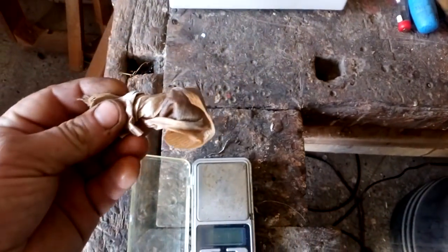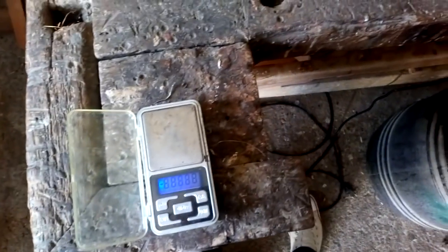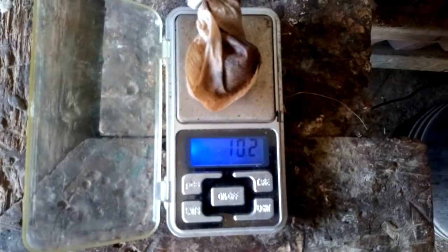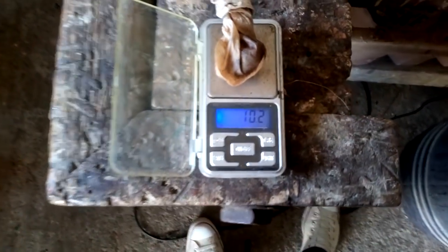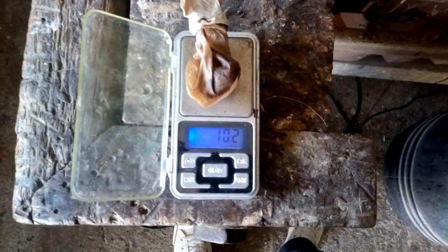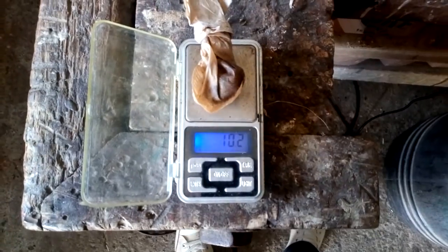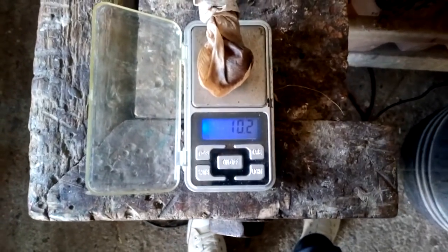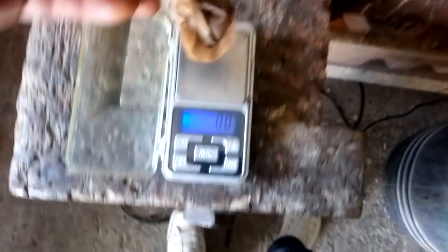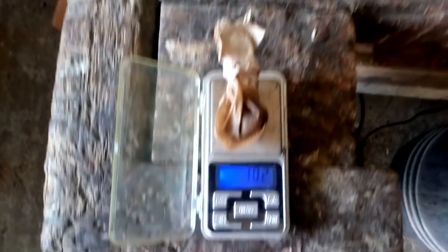In this filter I got dried gold dust. This is from the bulk batch, the bulk pins. Now we got 10.2 grams of gold with the filter. An empty filter is about 1.3 to 1.4 grams, so we got here about 8.8 grams of gold. See that? Very cool.